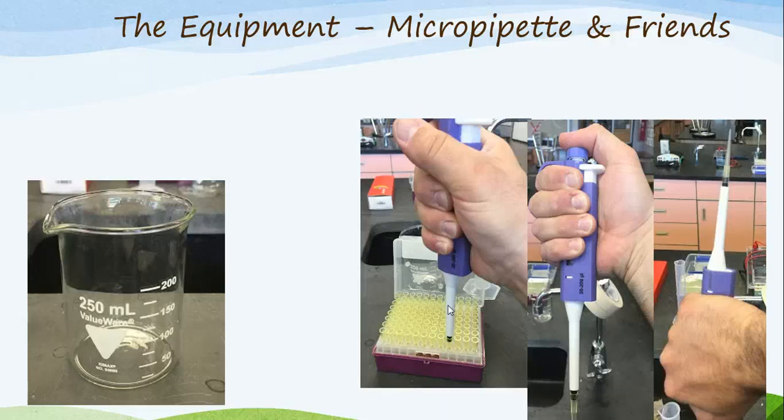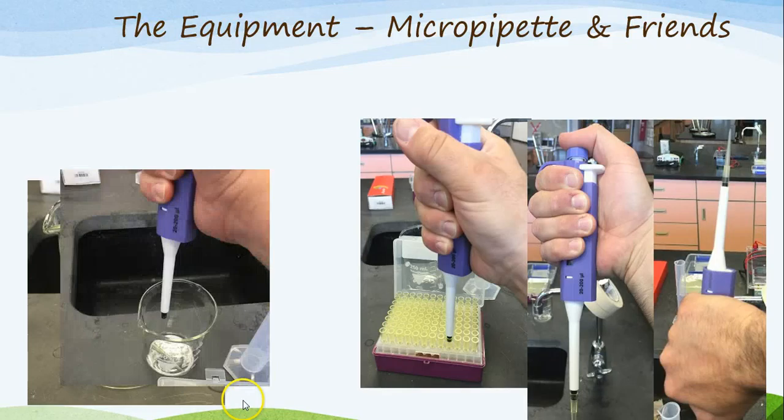How do we avoid that? We have this thing called a beaker. That beaker is going to be used to eject micropipette tips into it. Only used ones. How do you eject it, you say? That is this white ejection button or plunger right here. By pressing this down, it causes this tip on the end to fall off into the beaker. This is how we properly dispose of them.